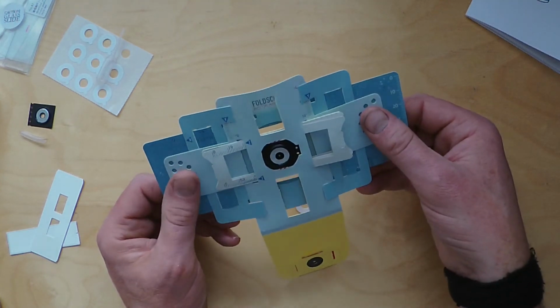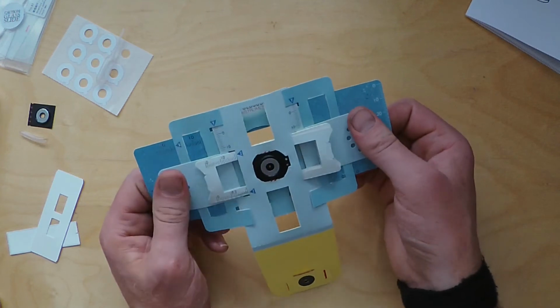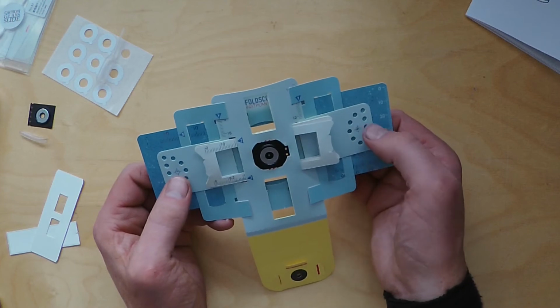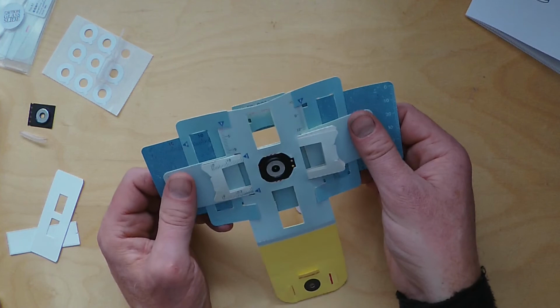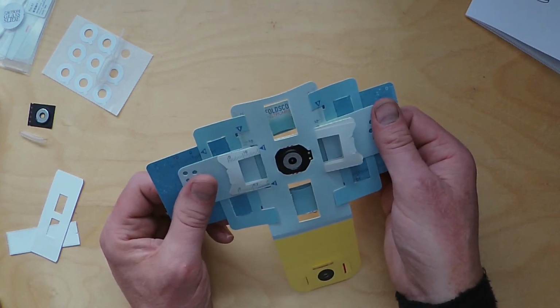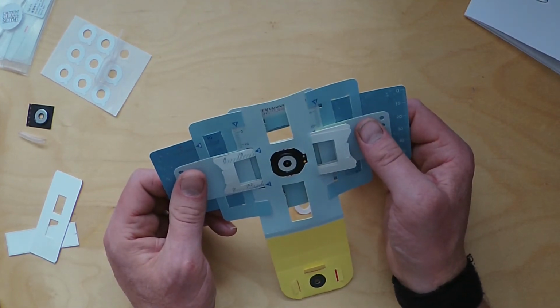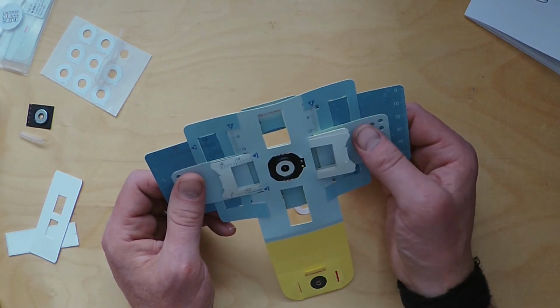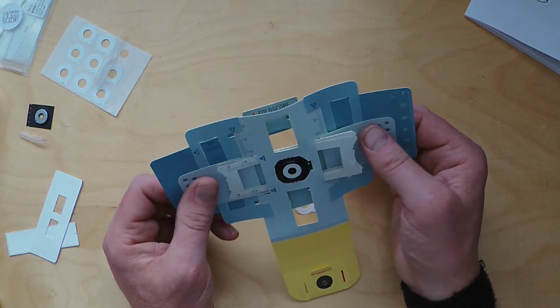You'll see now that you can, holding it with two hands, your thumb on these two holes here, you see the registration point, that sort of helps you grip it, and you can see I can move it up and down the y-axis and left and right on the x-axis. So if you are looking for a specific thing, you can say, oh, you know, 5y, minus 5x. So if you want to find a particular thing.